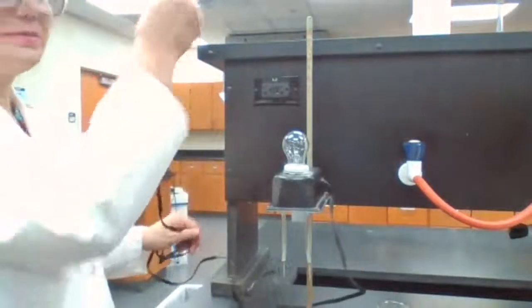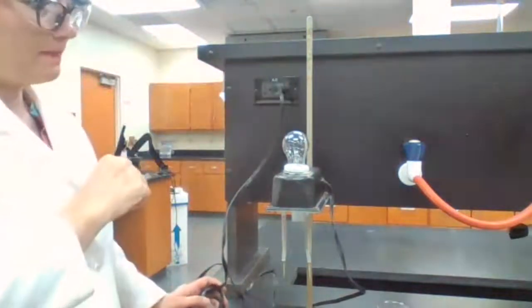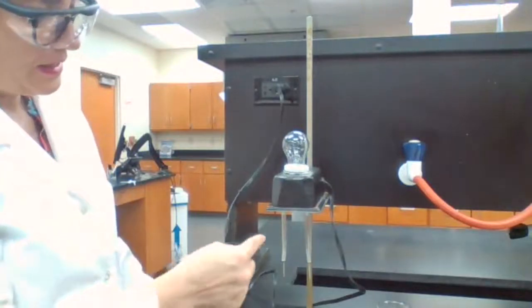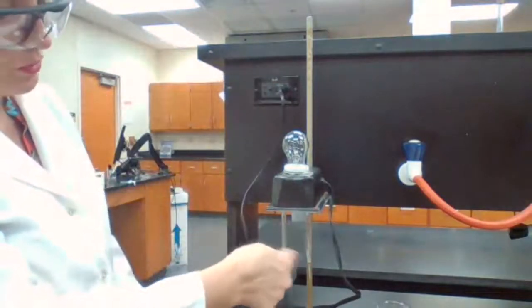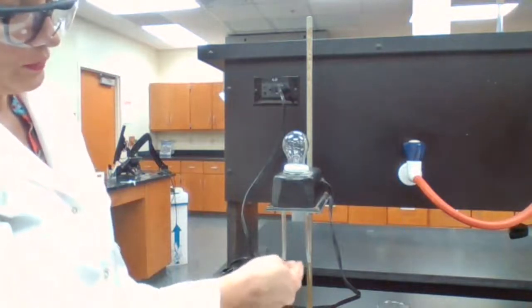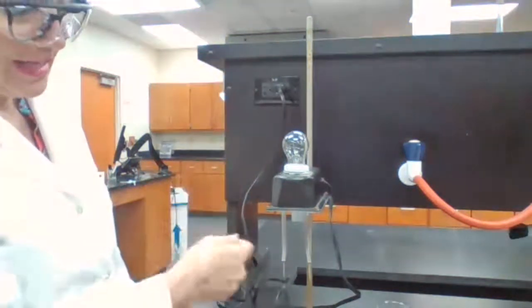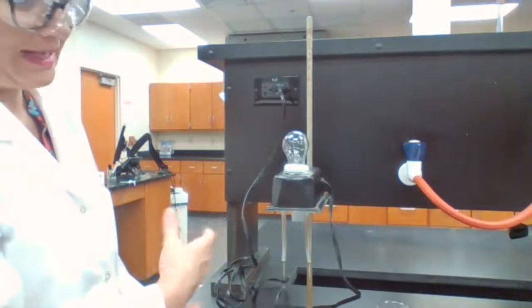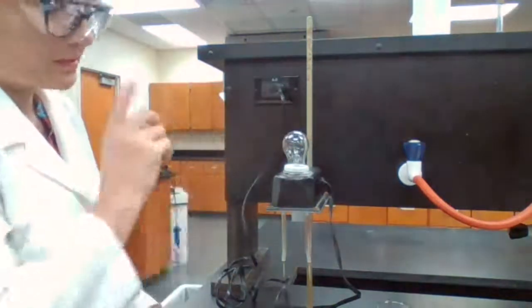If I plug the conductimeter into the wall power, if air was a good conductor of electricity, you have the electrons coming in, but it's separated into two poles. If the electrons are moved from one pole to the other pole, then this light bulb is going to light up. If what you have between the 2 poles are insulators, not good conductors of electricity, the light bulb is not going to light up.